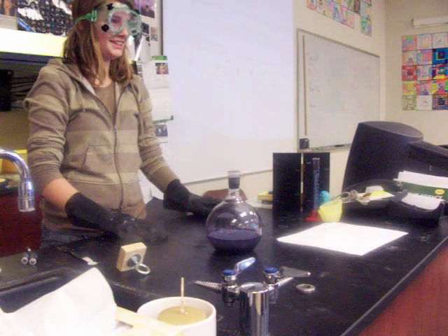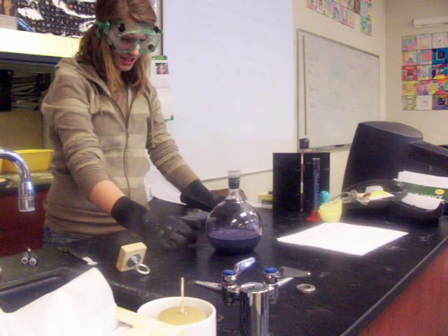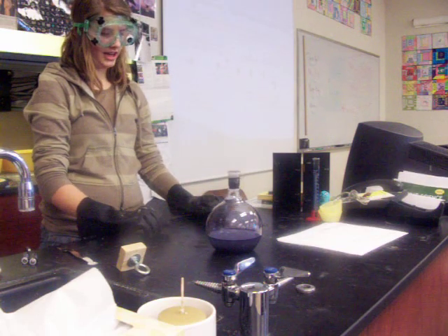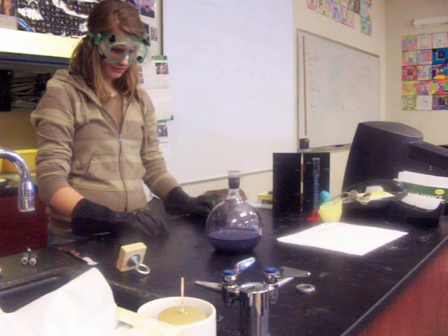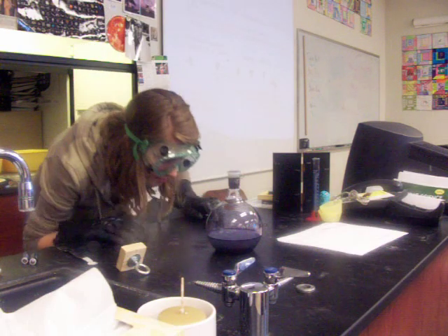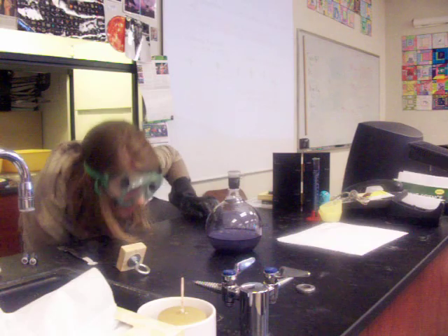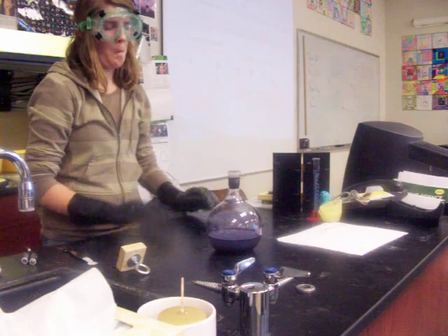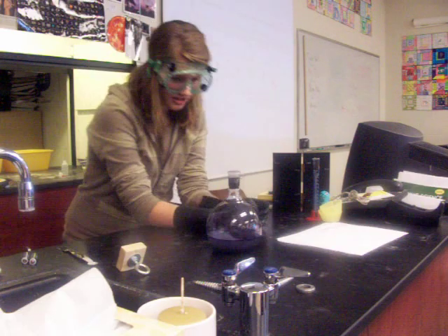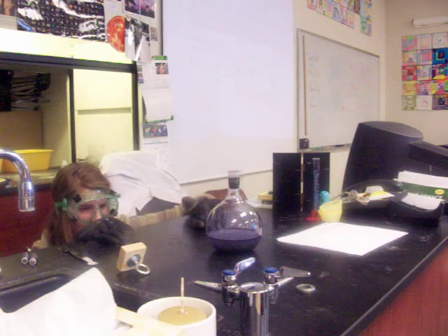It's getting clear — it just takes a while. It still has a lot to do. But the top looks a little clearer. Can you see the difference? It is dark and very clear on top. It's darker on the bottom — those are the solids that need to dissolve.